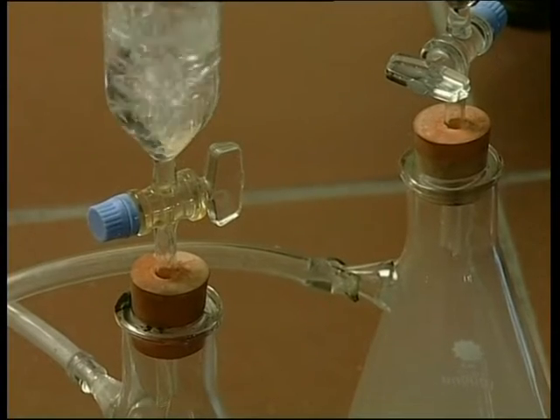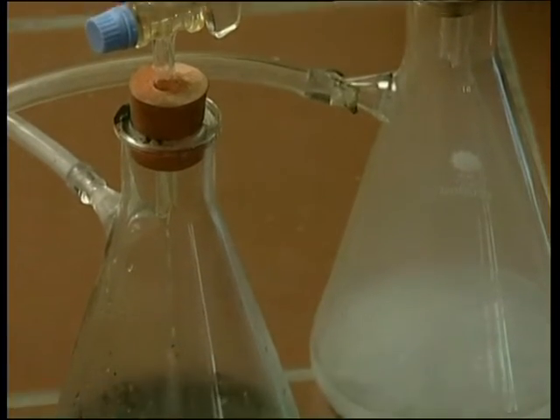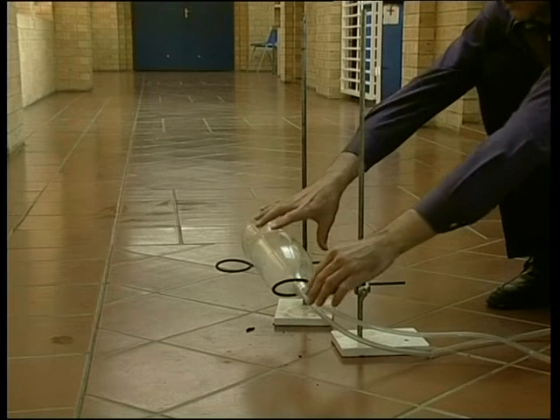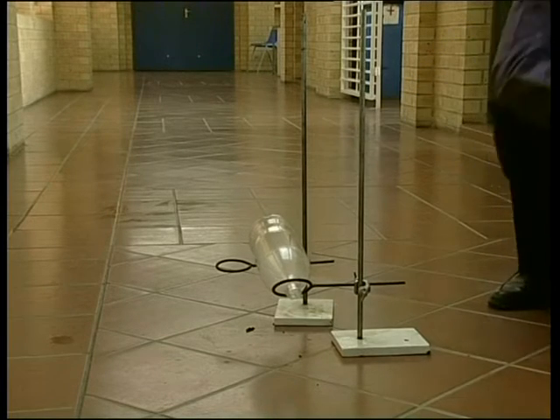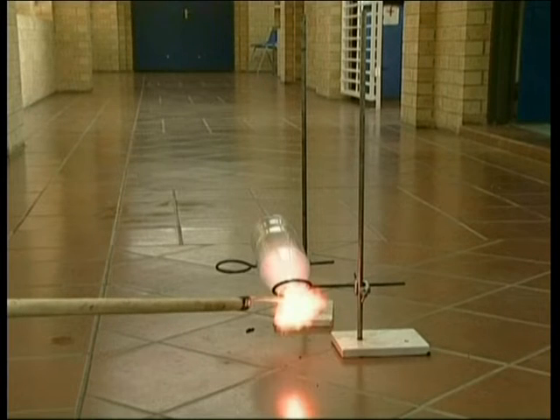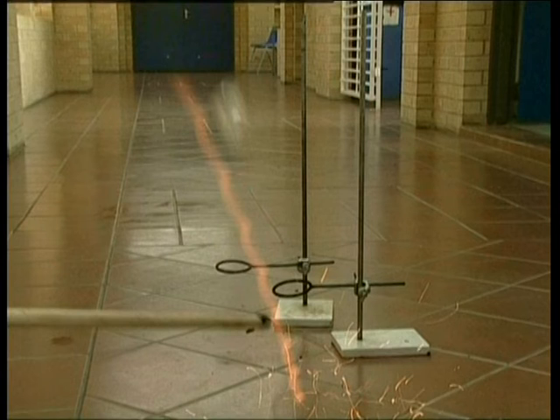If a similar experiment is done with a slightly larger amount of hydrogen gas the results can get quite spectacular. Look at this. An empty 2-litre plastic bottle is filled with hydrogen and oxygen using a chemical process. The bottle is then placed on a flat surface clear of obstruction on its side. Using a long splint the gas at the mouth of the bottle is set alight. Why do you think the bottle took off like a rocket? Well, the bottle pushes out the exploding gas — escaping gas pushes back against the bottle, moving it forward. This experiment can be very dangerous and should not be attempted without supervision.